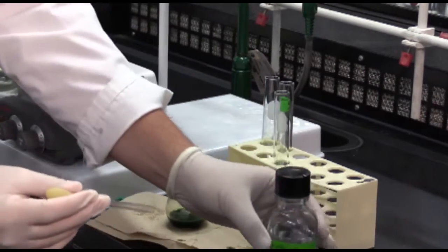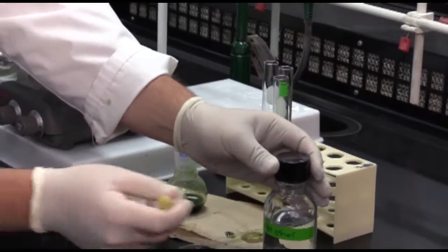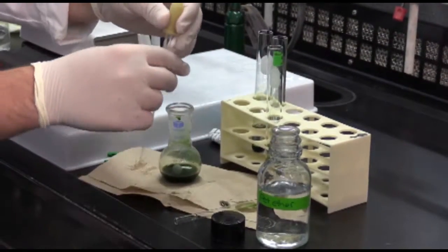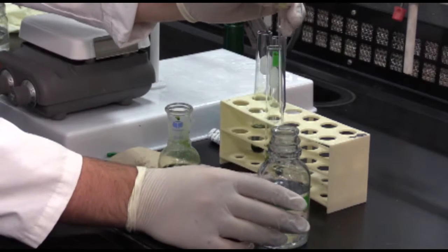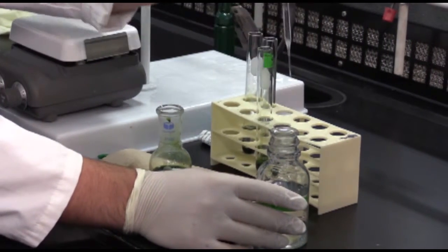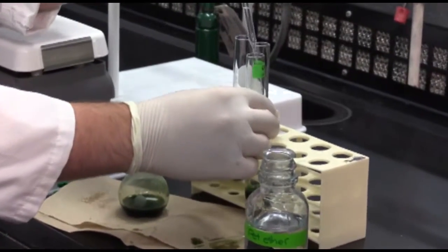We're going to use pet ether. Grab some pet ether and add it to the test tube.